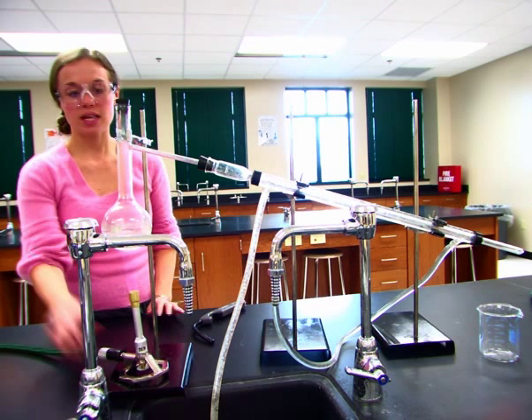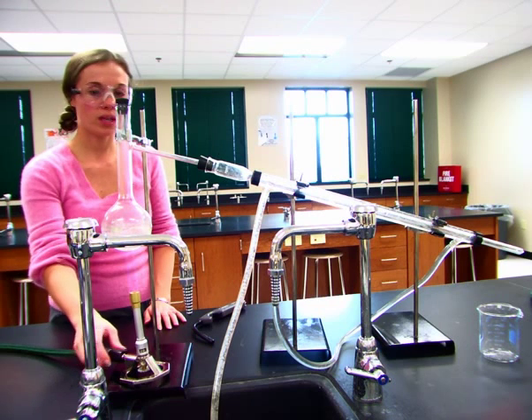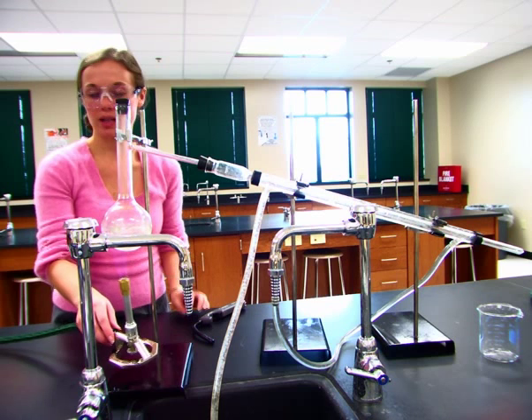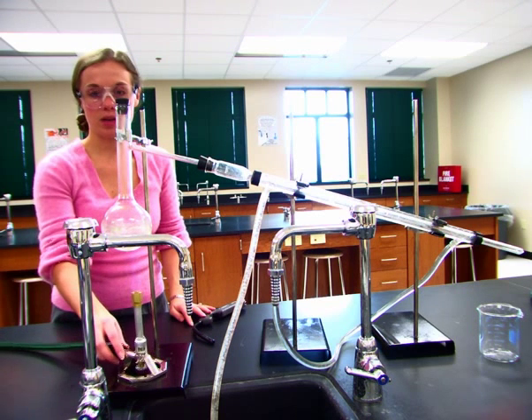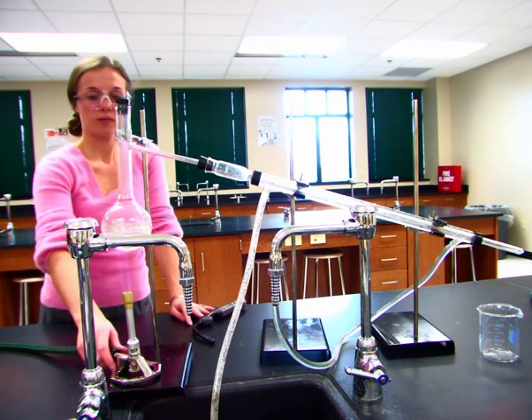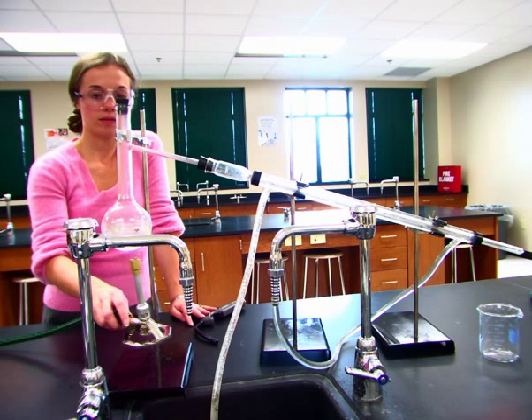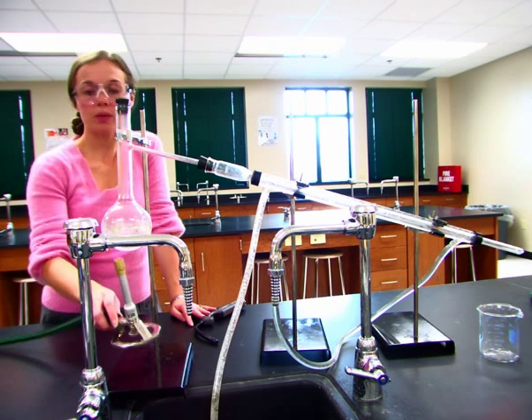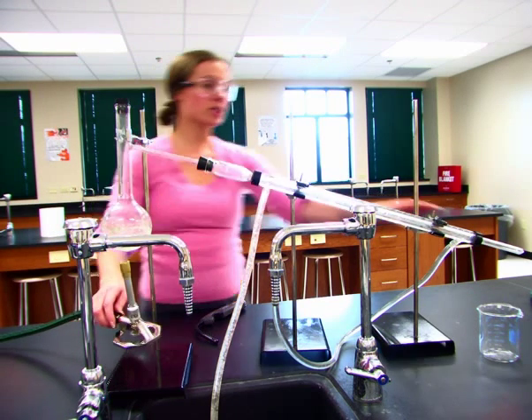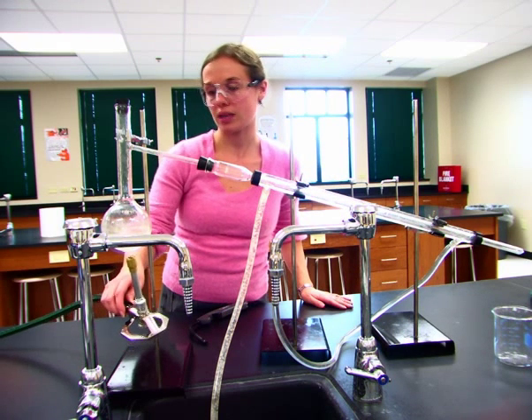Okay, as you can see, a little bit of vapor is starting to condense on the tube. We'll get a little bit more going here in just a second. Got a little bit of bubbles forming on the sides of the beaker. Now what we will see as this gets going is that this will become more and more cloudy as we start collecting the clear liquid on the sides. Alright, now we're really getting the boil going.